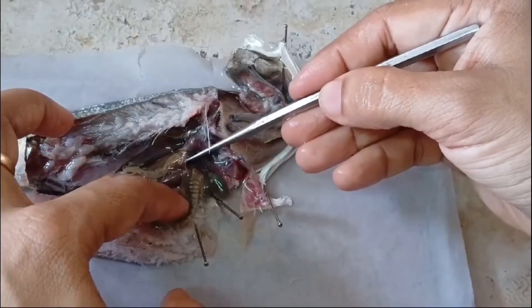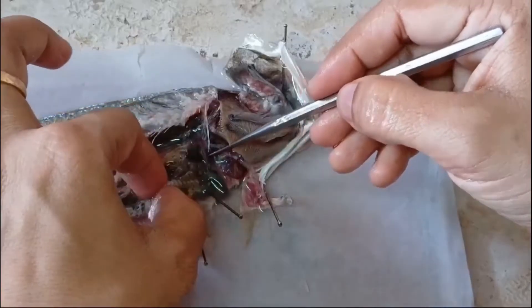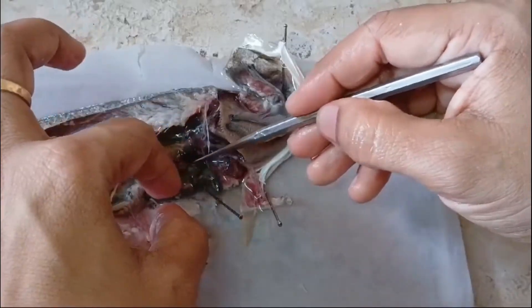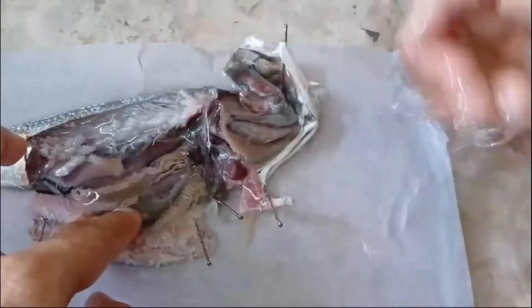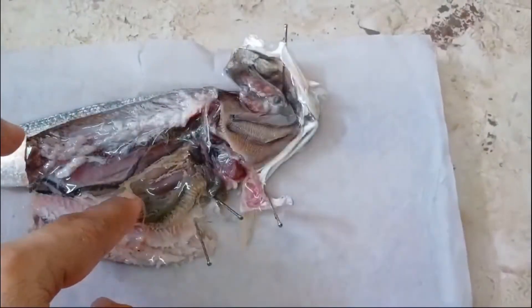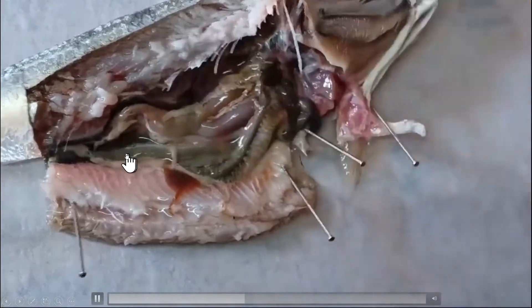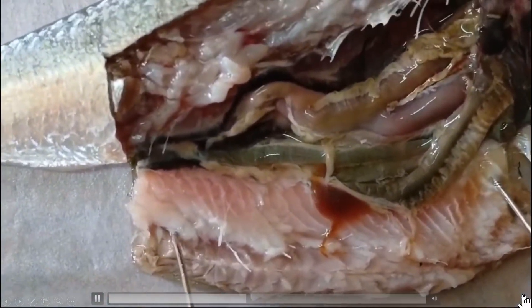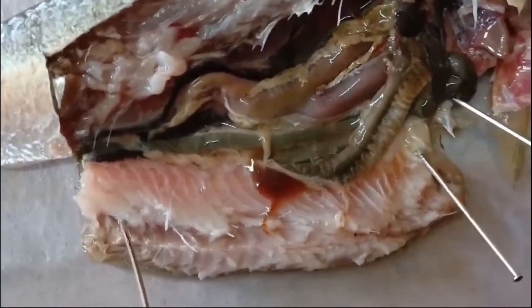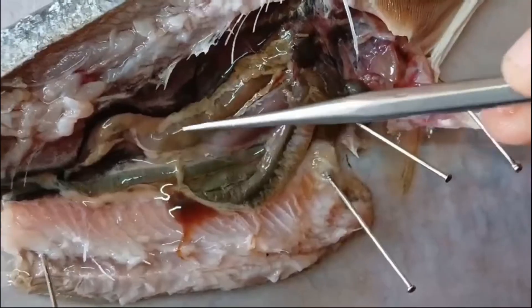I'm breaking that membrane — it is so delicate. This membrane is actually keeping the intestine securely intact in position inside the body of the fish. The flushing water is doing its job here, as you can see. As you start to get a good view, you can track its path and continue your uncoiling job.